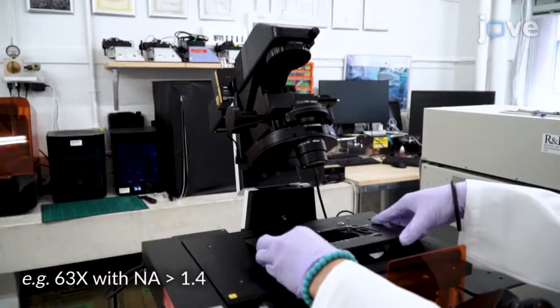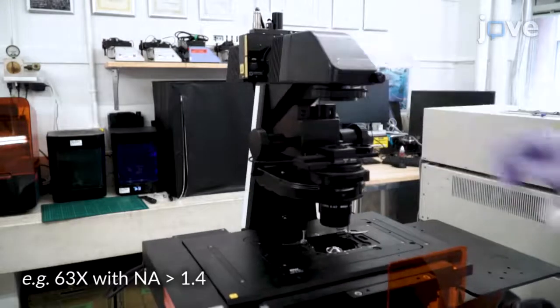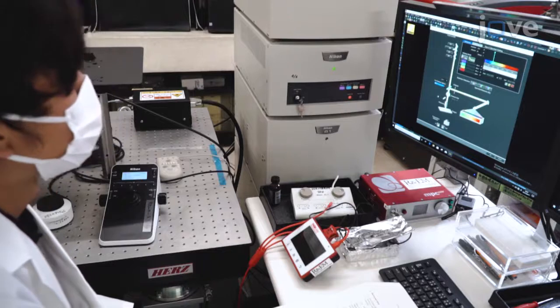Equip the microscope with a high numerical aperture objective with adequate magnification and a half-reflection mirror to accommodate confocal reflection microscopy, which relies on the cellular scatter of incident light to visualize cell morphology.